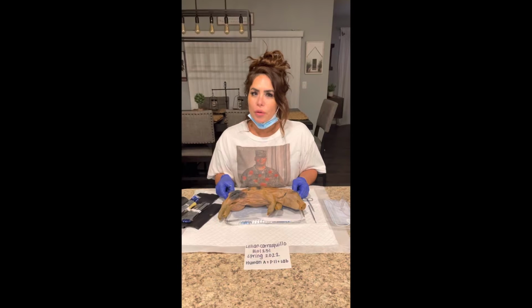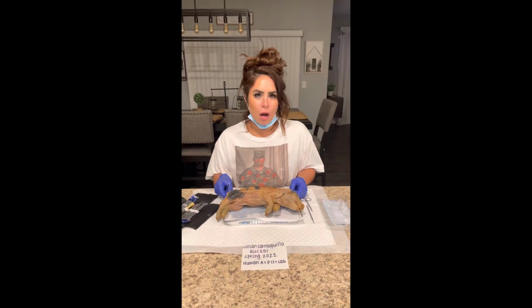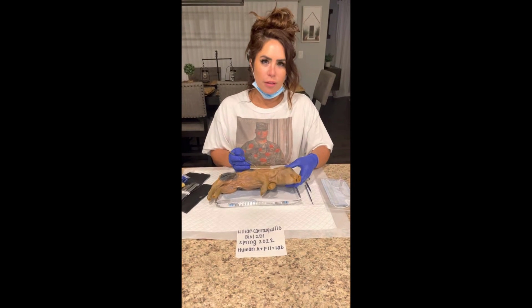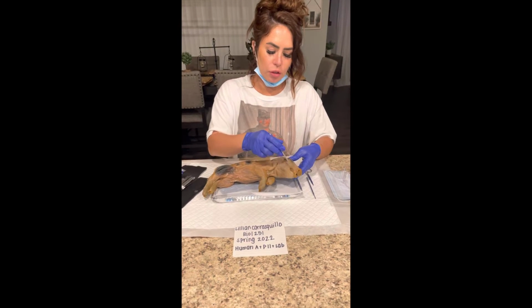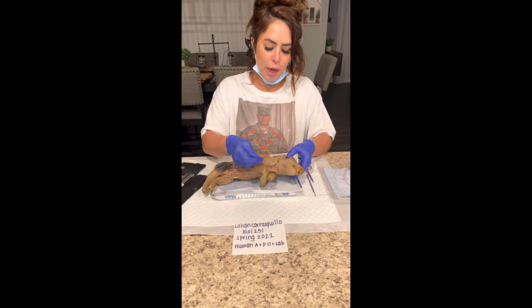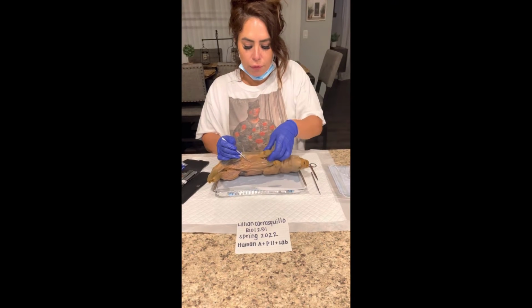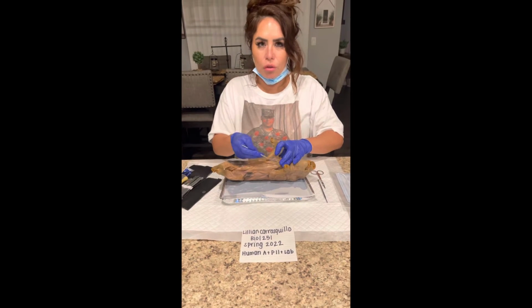Moving right along to the introduction of our fetal pig, we're going to discuss the exterior part of our specimen. We begin with discussing where the head region is located, and it's just right here. Below that is the neck region, and flip it over to the side, you'll be able to locate the trunk.